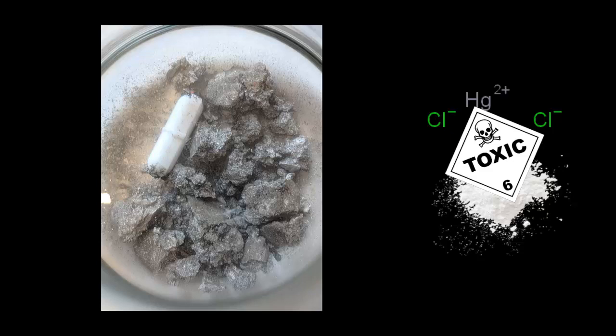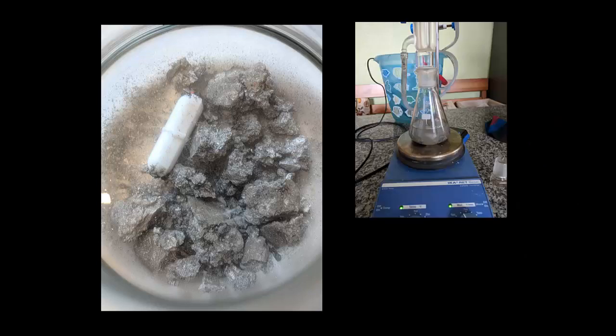To demonstrate the application, I took some anhydrous isopropanol and reacted it under reflux for 6 hours with the activated aluminum.